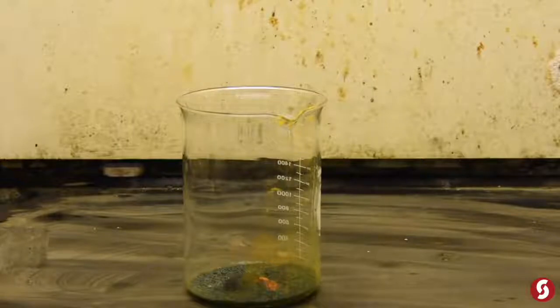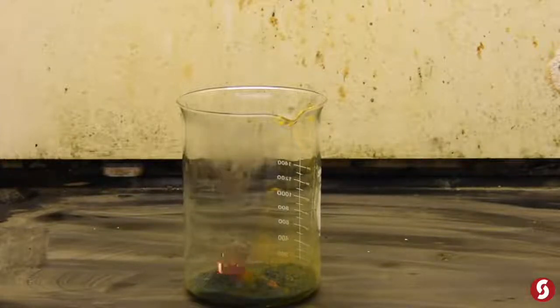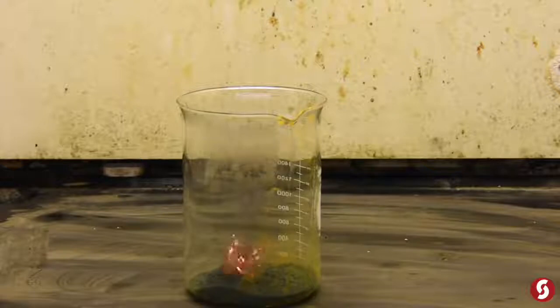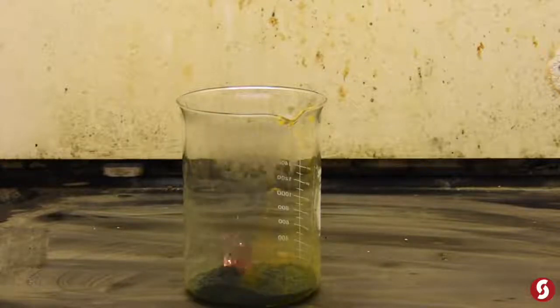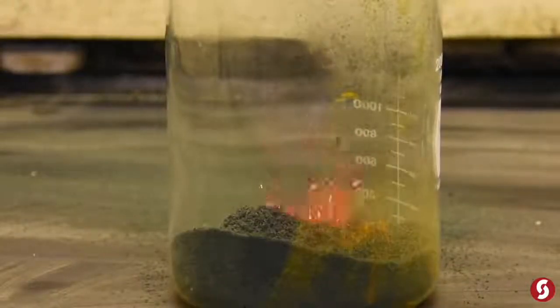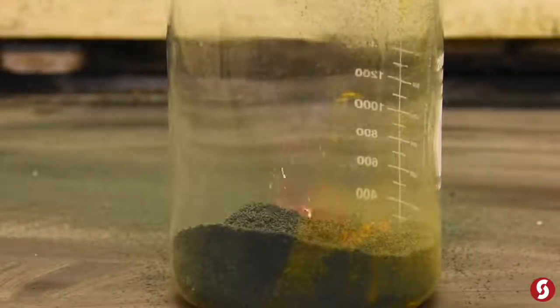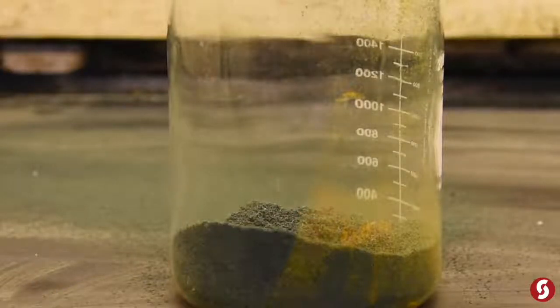Can't keep my propane torch lit. It's kind of going — there it goes. It was hard getting it started but now it's going. All that green stuff is the Cr2O3 — that is chromium(III) oxide — and you can see all the gases that are produced. It's just throwing all that solid all over the place right until it's just about to fizzle out. You can tell that's like several-fold the original volume.